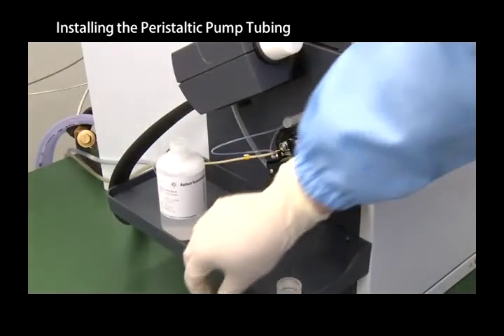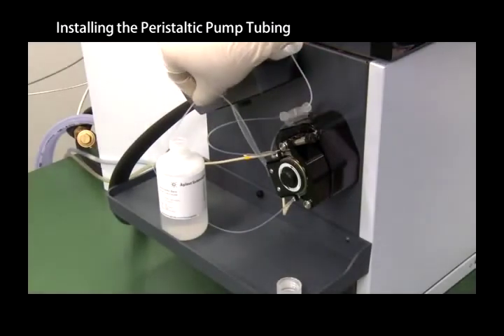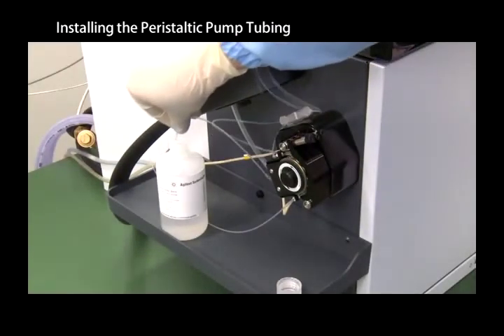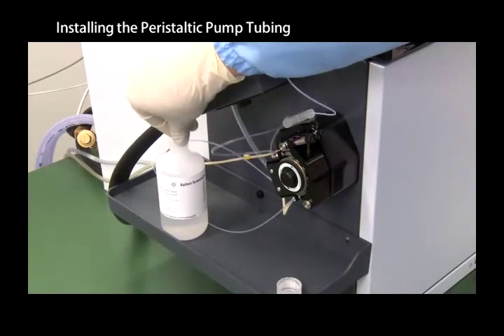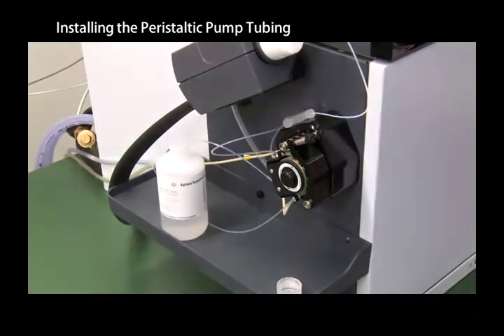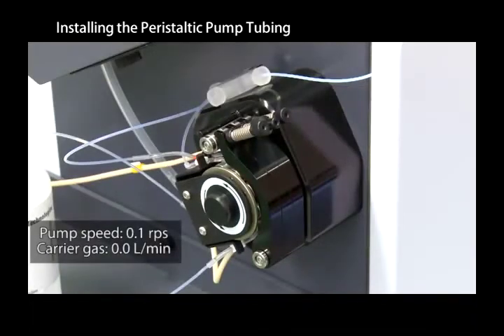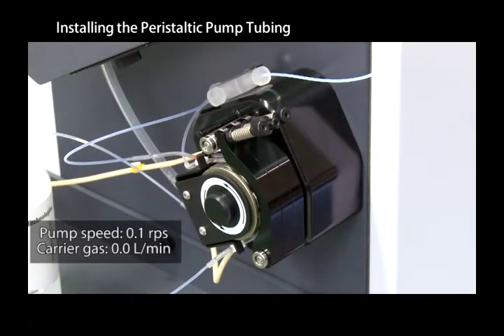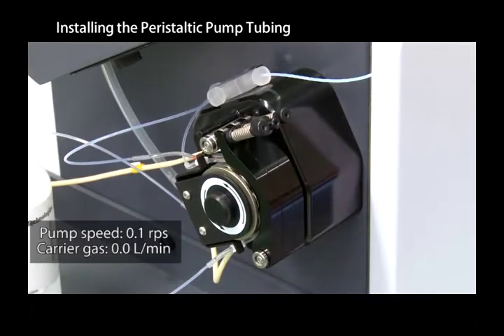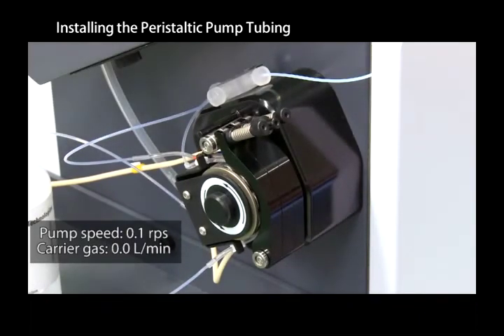Place the end of the sample tube and the internal standard tube into pure water. Set the peristaltic pump speed to 0.1 rps and the carrier gas flow rate to 0 liters per minute from the MassHunter screen.